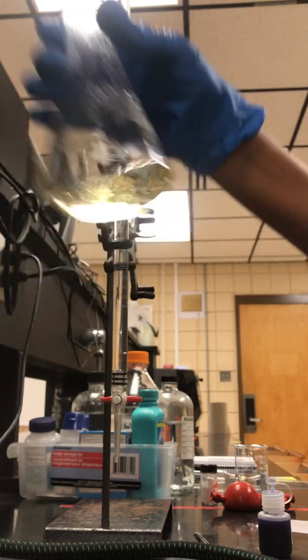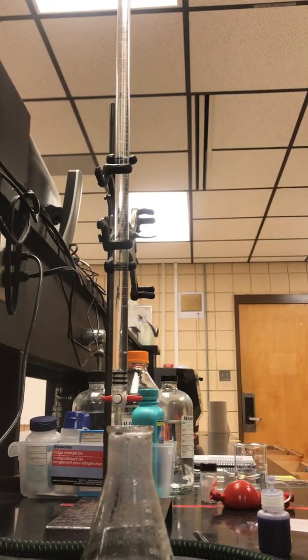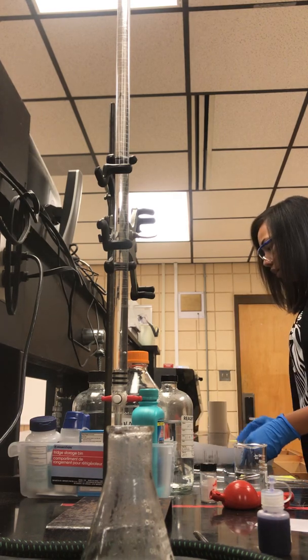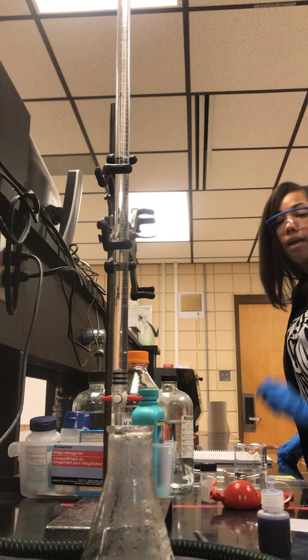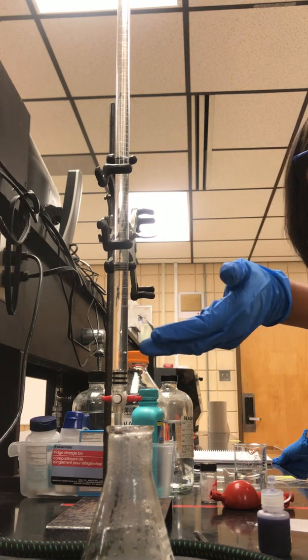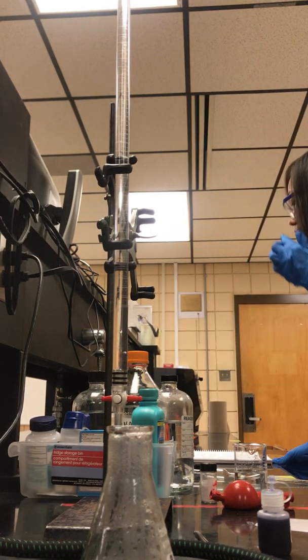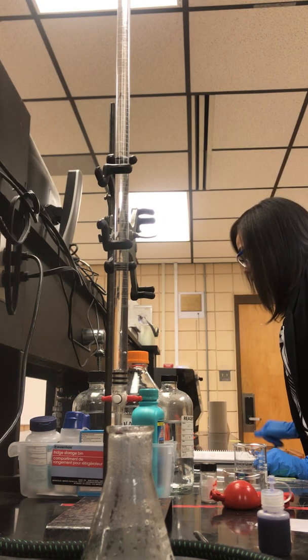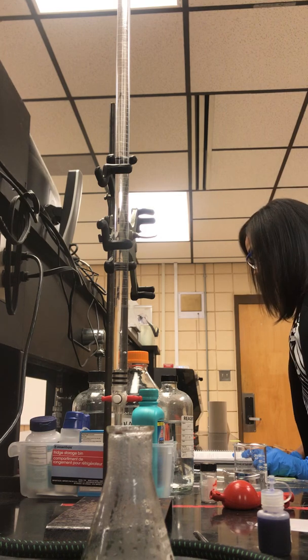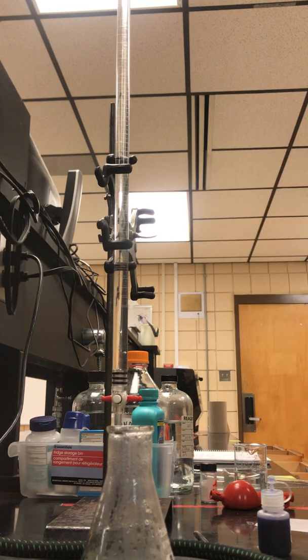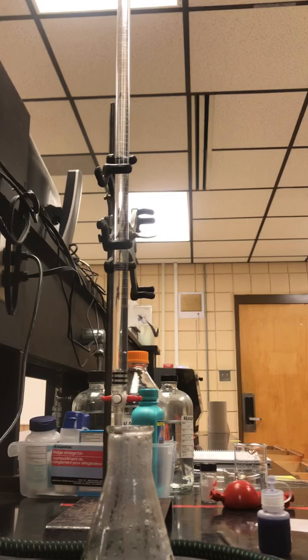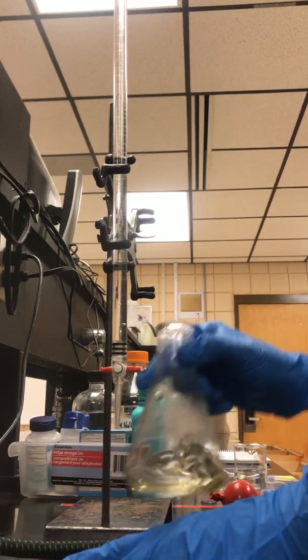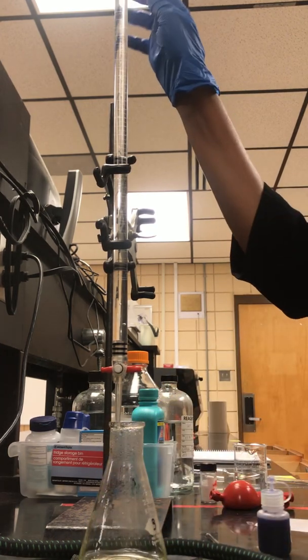After we've let our solution cool, they tell us to begin the titration. Make sure you watch for bubbles. I do have bubbles at the bottom. They tell you to remove those bubbles if needed. When we do our titration, at our endpoint we should have a faint blue color.